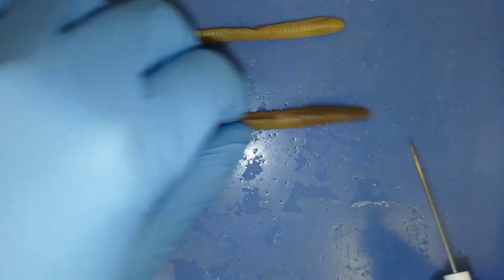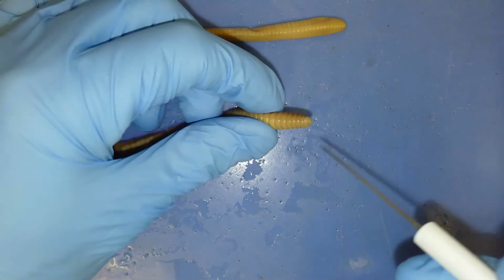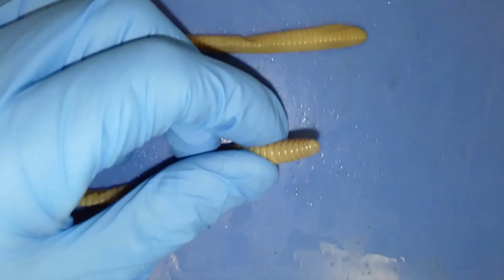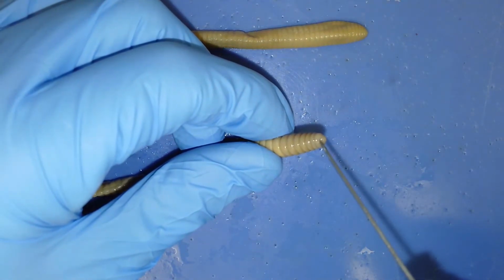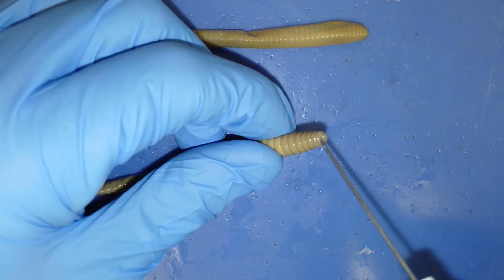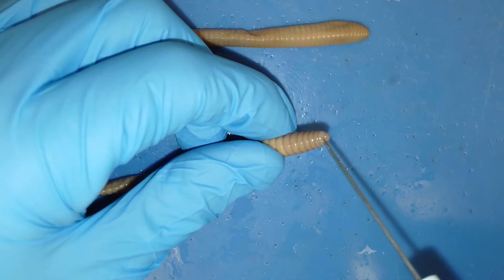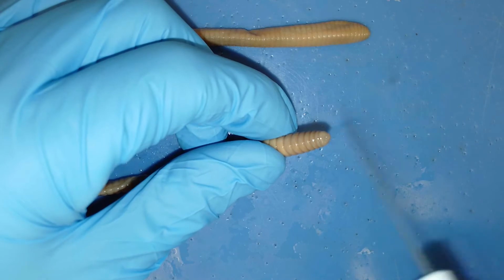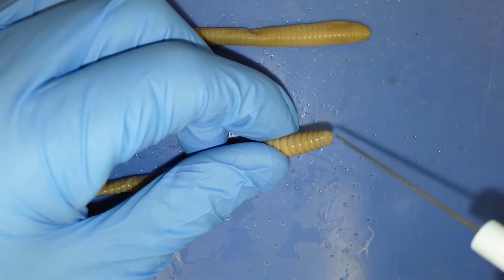So if we look closely at the mouth, if we flip this guy on its side, you might be able to see in this video, if I bring it a little bit closer, that the mouth is on the underside of a segment right here. I have the teasing needle in the mouth right now. You can see there's a fleshy lobe right here that extends past the mouth. And so this fleshy lobe is what we call the prostomium. So that prostomium is keeping soil out of the mouth while this organism is burrowing.